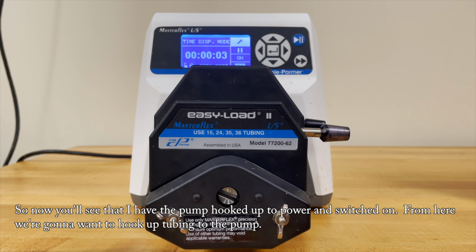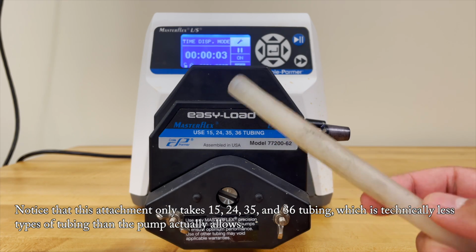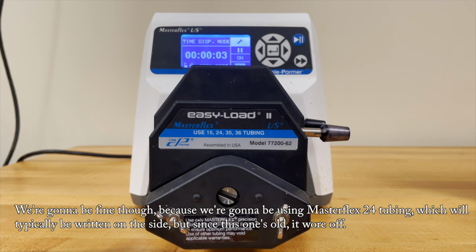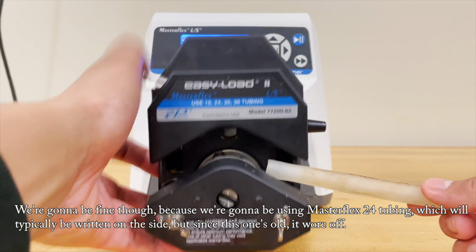So now you'll see that I have the pump hooked up to power and switched on. From here, we're going to want to hook up tubing to the pump. Notice that this attachment only takes 15, 24, 35, and 36 tubing, which is technically fewer types of tubing than the pump actually allows. We're going to be fine though because we're going to be using Masterflex 24 tubing, which will typically be written on the side, but since this one's old, it wore off.